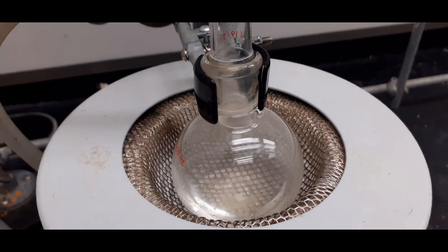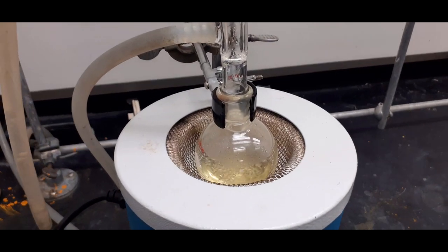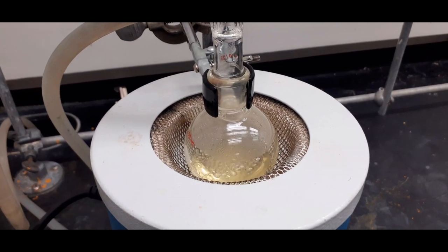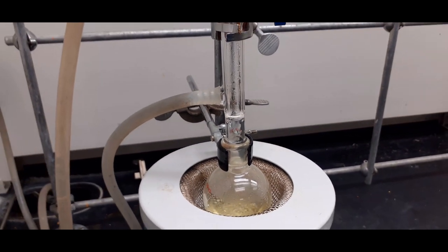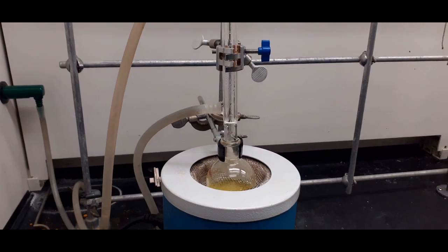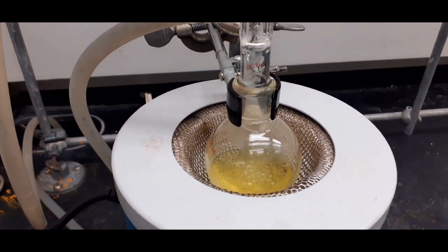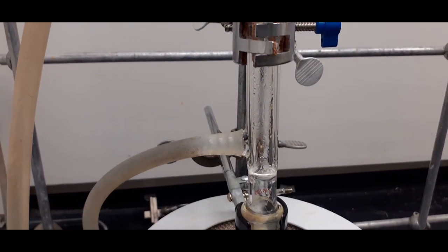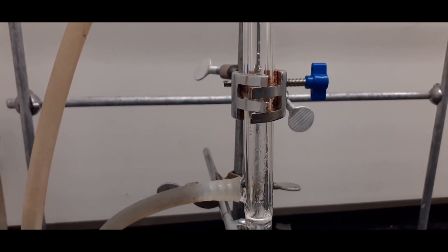This will now be gently refluxed for an hour. As we see here, the solution has started refluxing. This is after an hour — the solution turns yellow. Notice the reflux ring in the condenser.